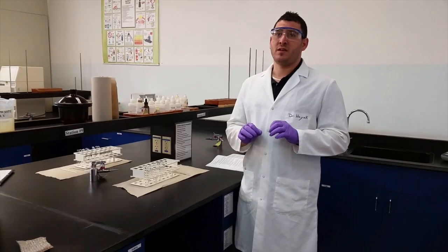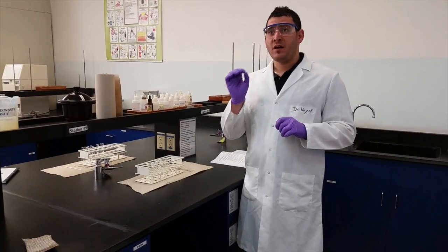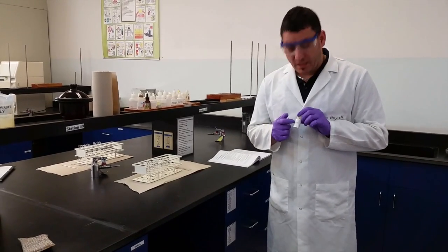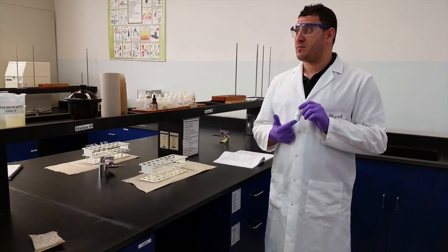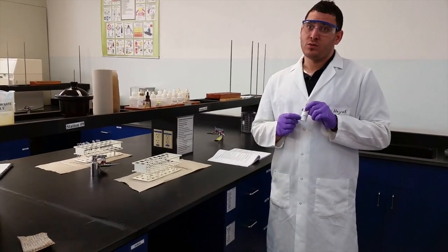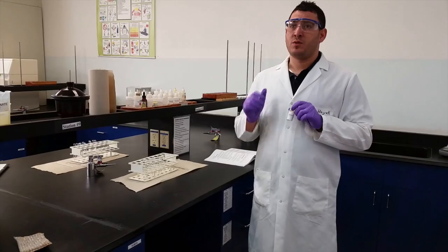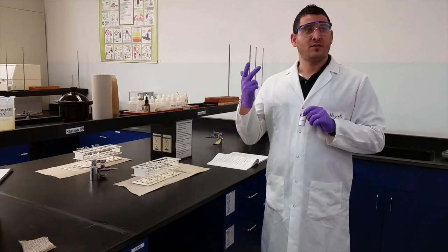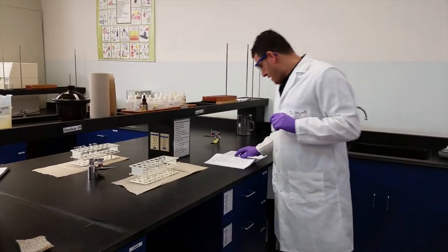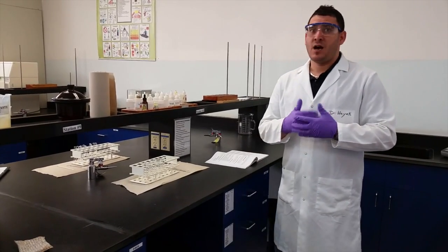The objective behind this experiment is to learn how, in a qualitative way, we can identify the anion that exists in a salt you don't know. All you can see is that it's an anion salt — a white powder. Today we will study how to identify the negatively charged ion, specifically the fluoride, chloride, bromide, nitrate, thiocyanate, carbonate, and sulfate anions.